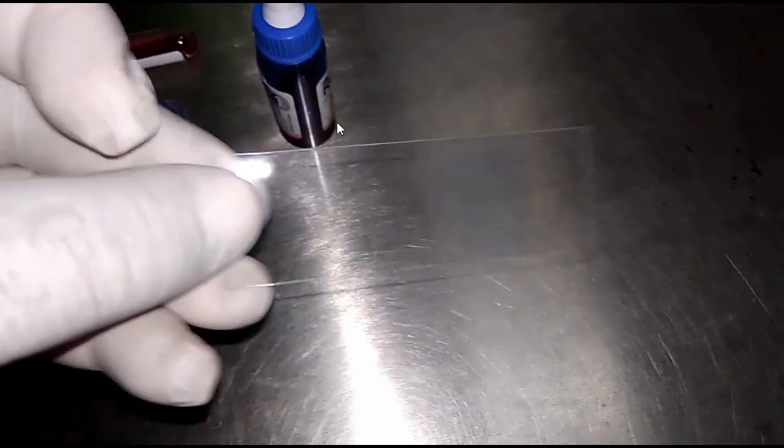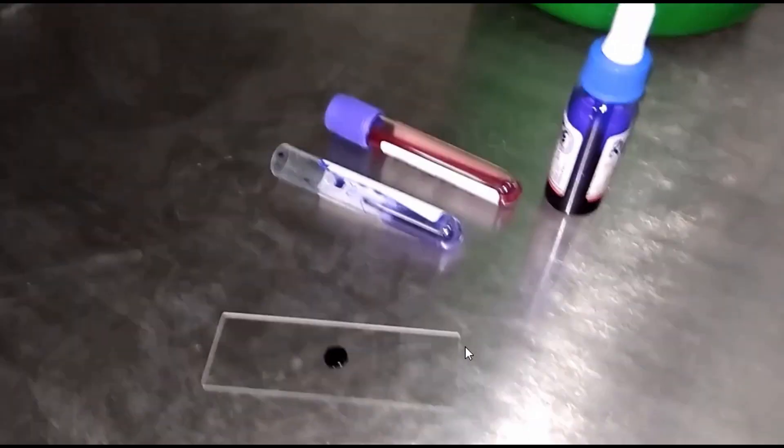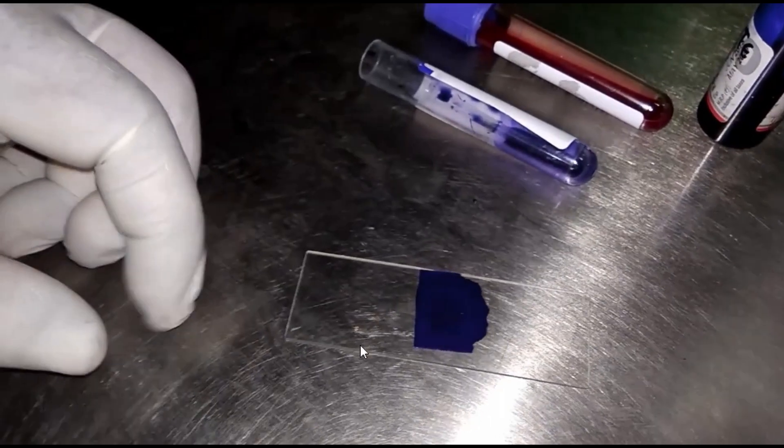This slide is for observation under microscope at 100x objective, and this one for 40x objective. From this slide we will be able to observe live microfilaria, and from this slide dead microfilaria will be seen.